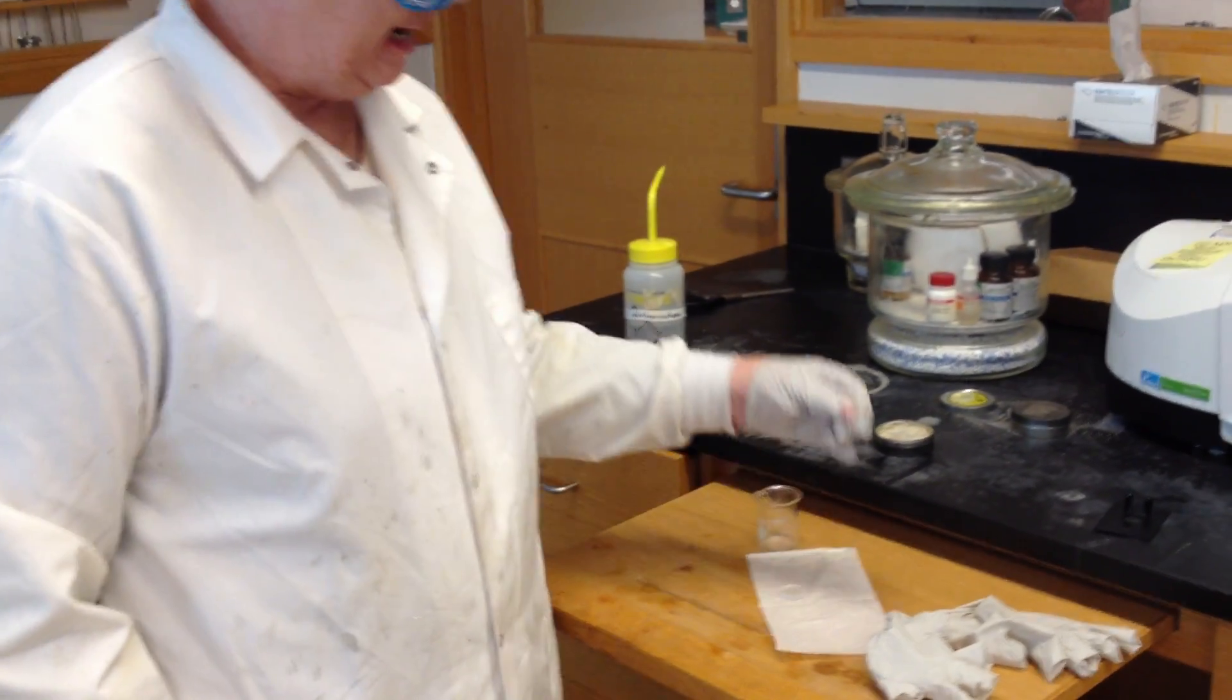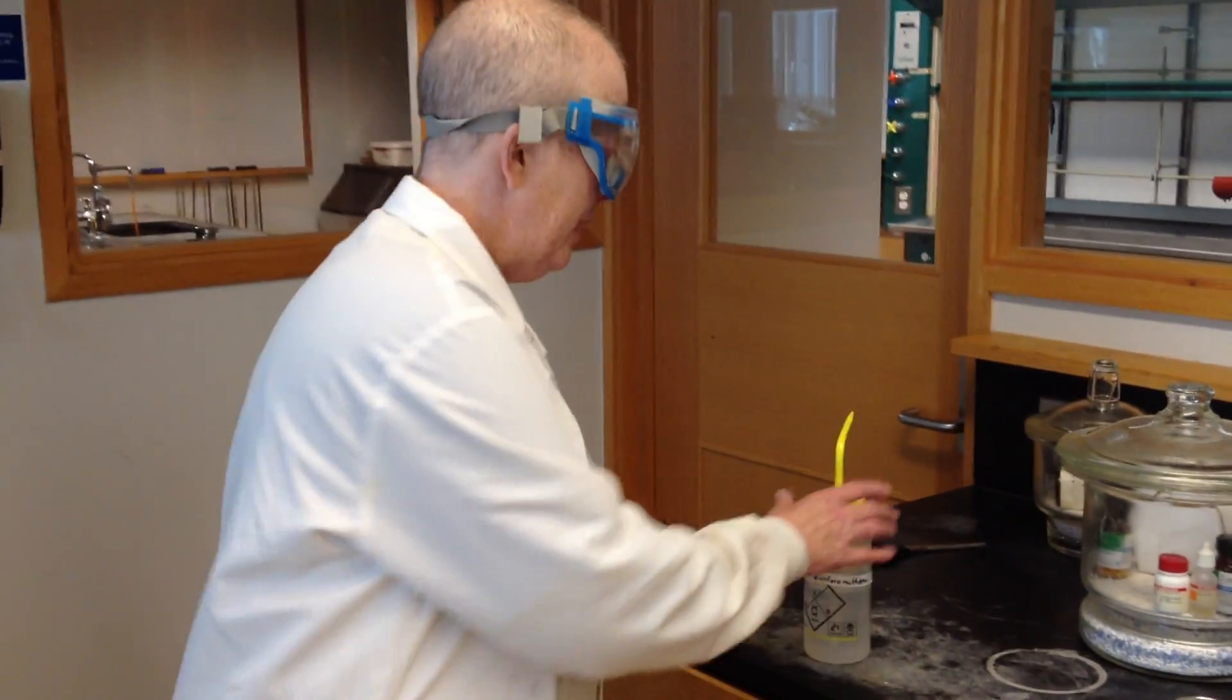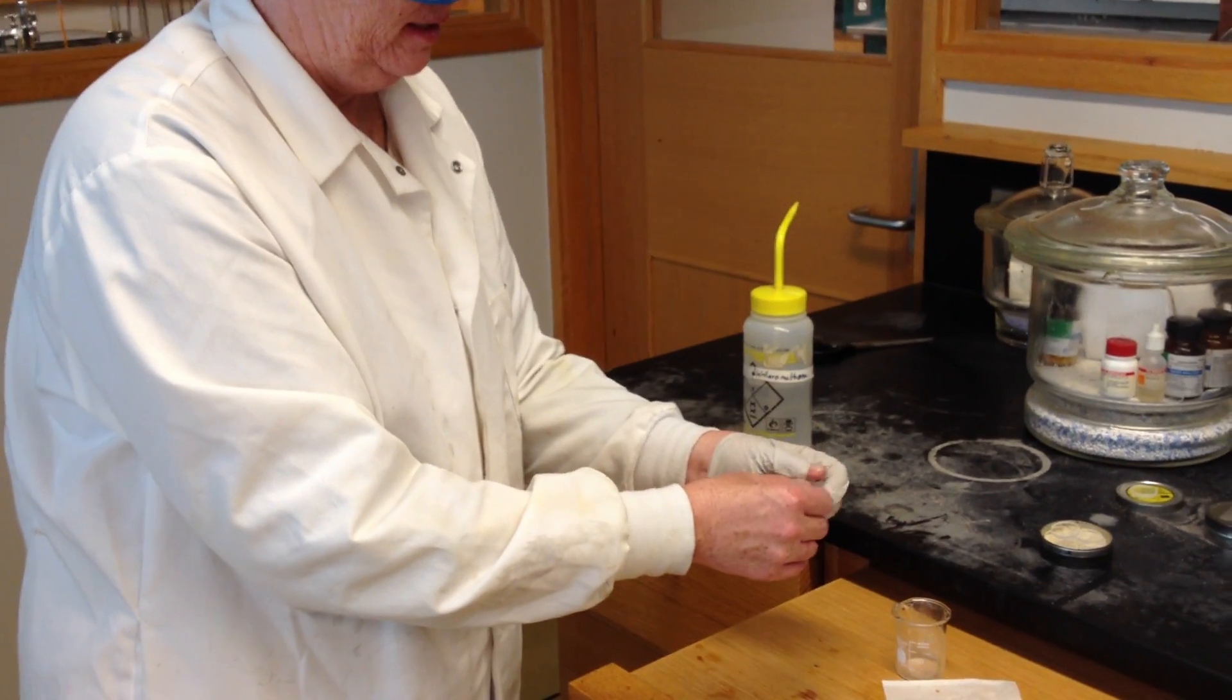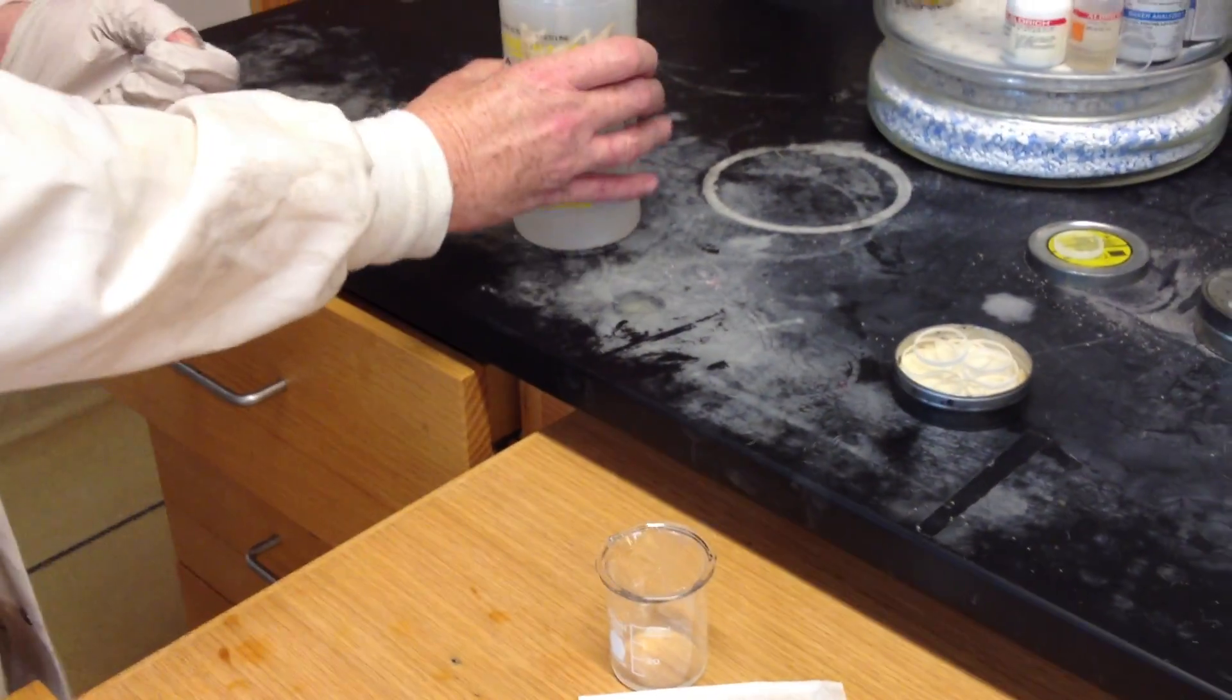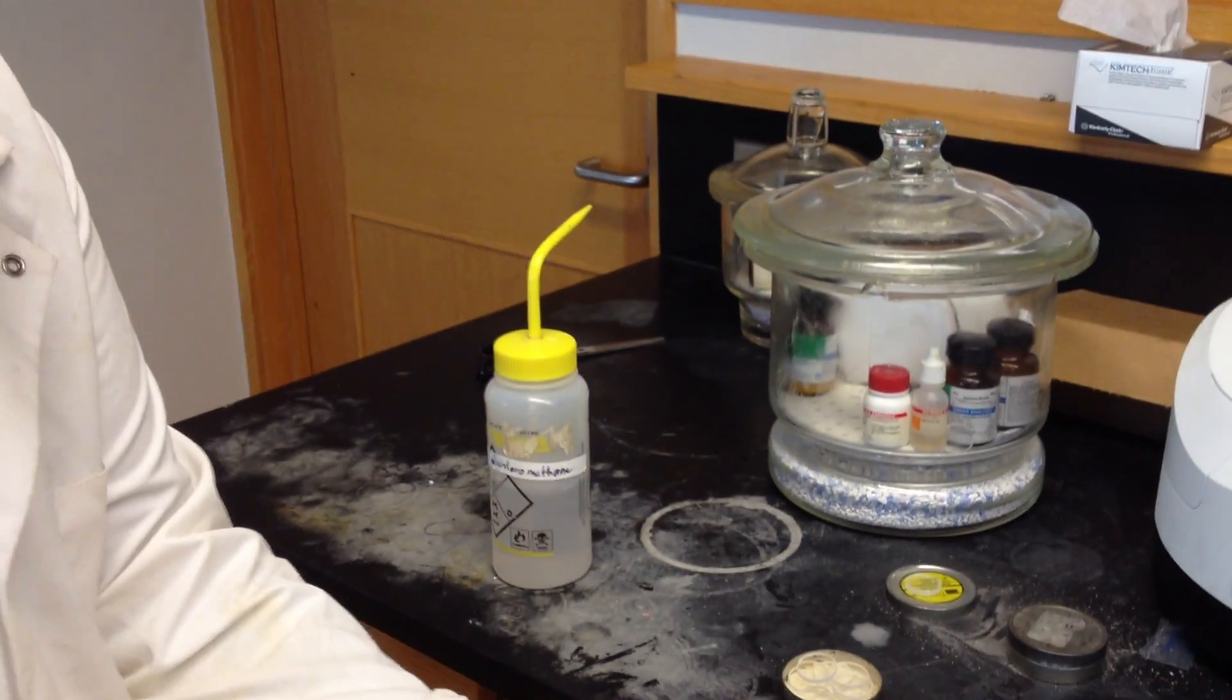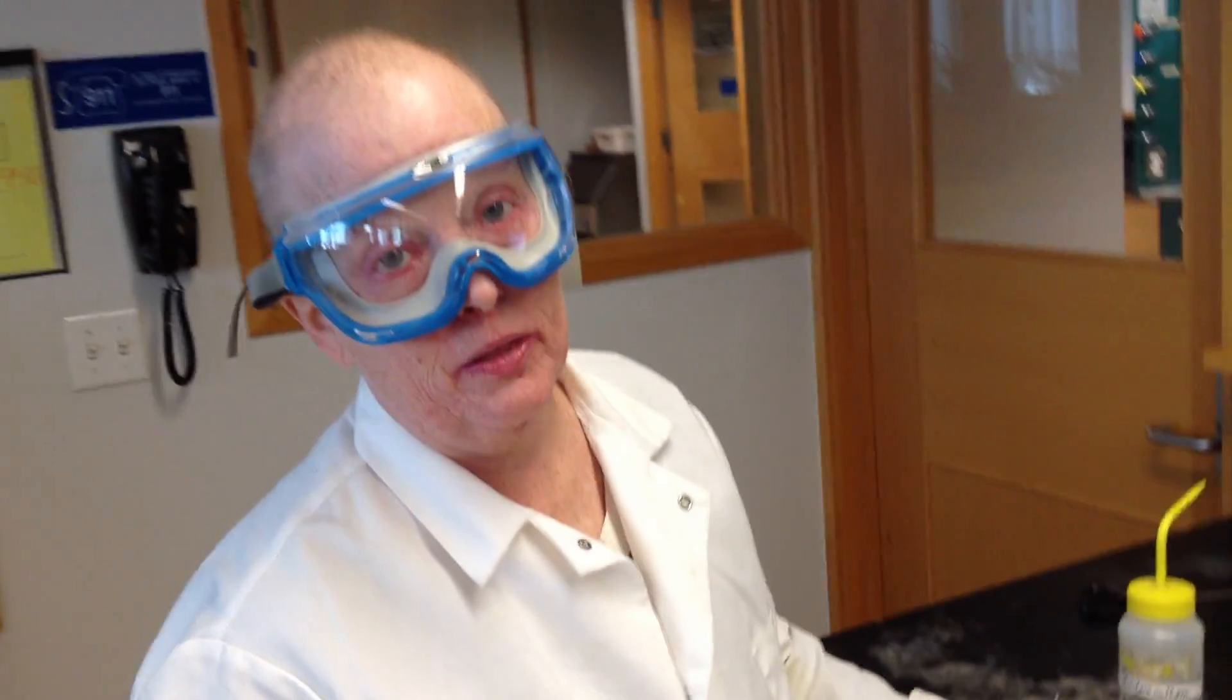The only thing you really need to know then is how do I clean the plate. The plate is out now because I took it out before because I ran that other compound. What you have to do is hold the plate over a beaker and use the dichloromethane. You have to be really gloved up, both hands. And you squeeze dichloromethane into it. You could just run some dichloromethane over it like that into your container. Then what you do is you take a Kim wipe. And remember, stay over this. This keeps you from breaking plates. Then you would just clean it with a Kim wipe. Then someone else could use it. So it's a good rinse with dichloromethane into a beaker wearing gloves, and then a good buffing with a Kim wipe. Then it's ready to go again. So I hope that helps you running your IRs and lab this week.